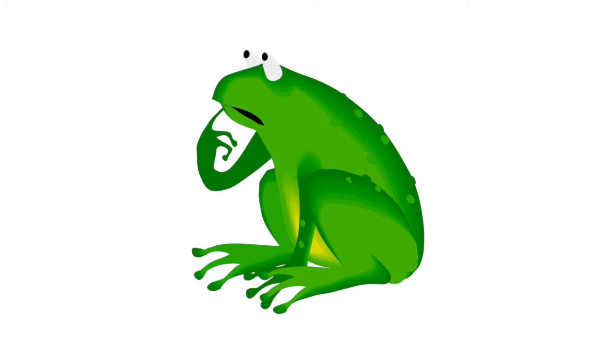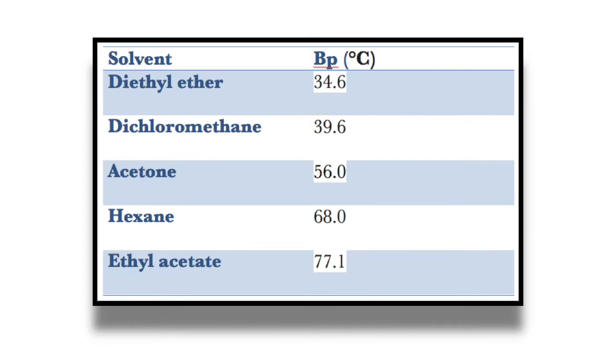Inevitably, students overthink it. 9 times out of 10, the reason why we cool the reaction before moving on has to do with the next thing we're going to add, which is usually an organic solvent with a low boiling point. So what happens, you may ask, if you add a low boiling point solvent to a hot solution? Look for yourself.